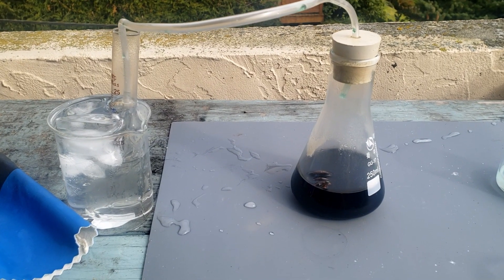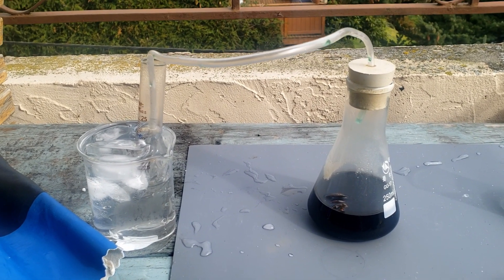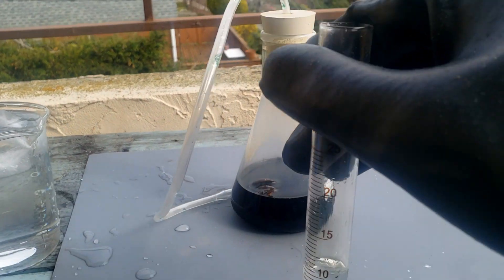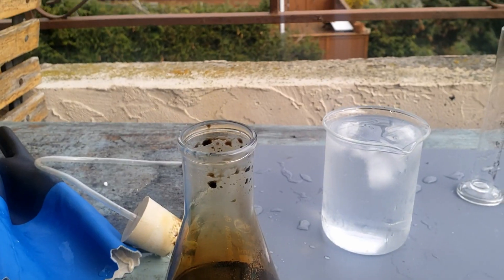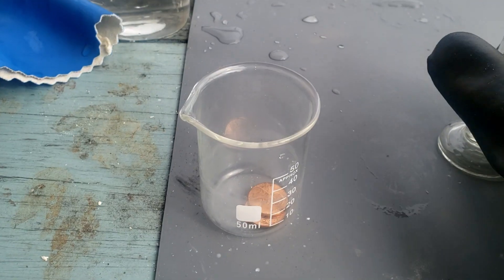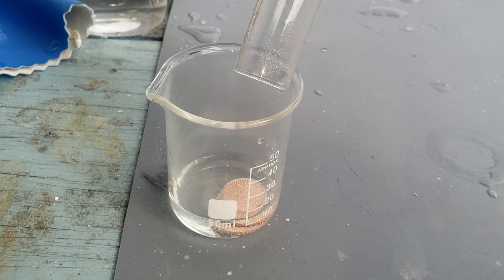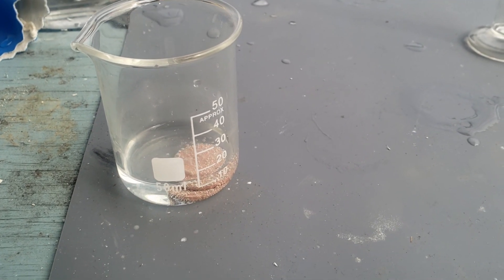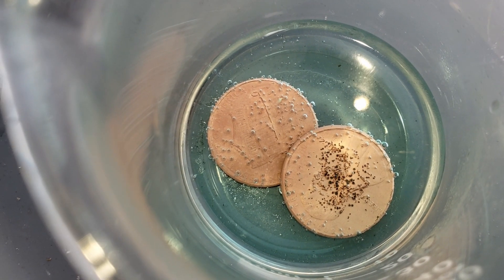It took about 2 hours for the reaction to finish, but if it still isn't reacting by the 4th or 5th hour, I would recommend restarting. There is only 10 milliliters of nitric acid, because halfway through I checked 15 milliliters to see if it was actually nitric acid. Once we take off the stopper, you can see the brown nitrogen dioxide still forming. I then pour the dilute nitric acid on some copper pennies to see if bubbles form and if the liquid turns blue. Bubbles immediately start forming around the copper, and after a couple minutes the liquid turns blue and the faces of the copper pennies start to dissolve and become less defined.